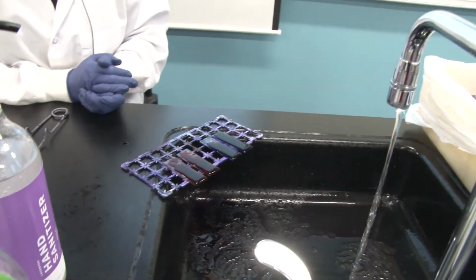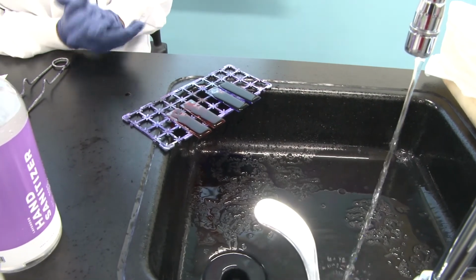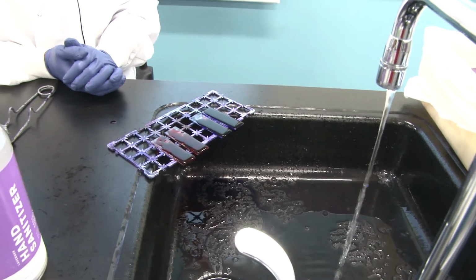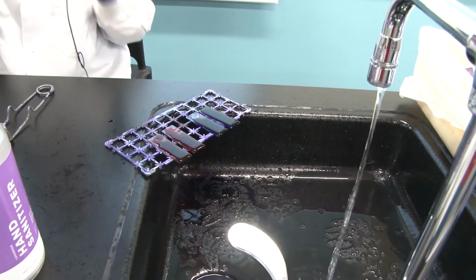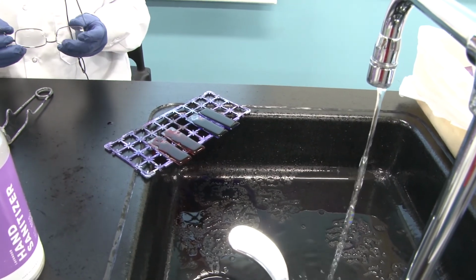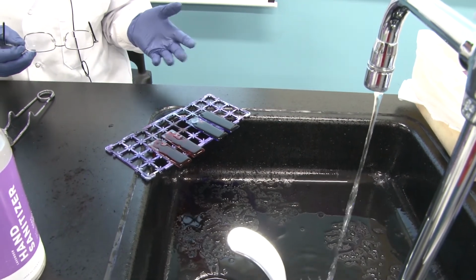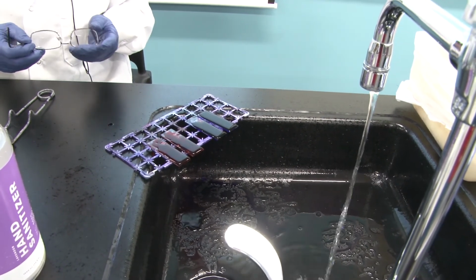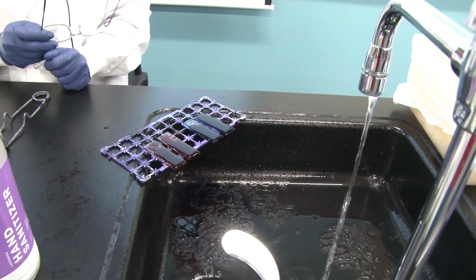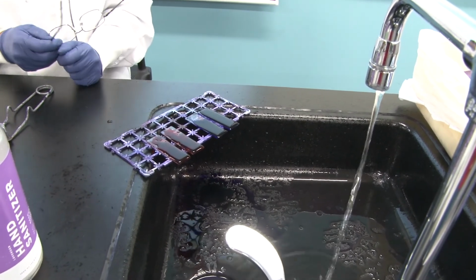Okay, so we let those dyes sit. 60 seconds is sufficient. In fact, about 30 seconds is sufficient, but you can let it sit as long as you want. The length of time that the dye sits on there is not going to matter, as long as it's more than 30 seconds or so, you know you got the cells stained. So we could let it sit on here for 2 minutes, 5 minutes, 10 minutes, not going to make a difference. What you never want to have happen, though, is you never want your dyes to dry out. So 1 minute is good for these.